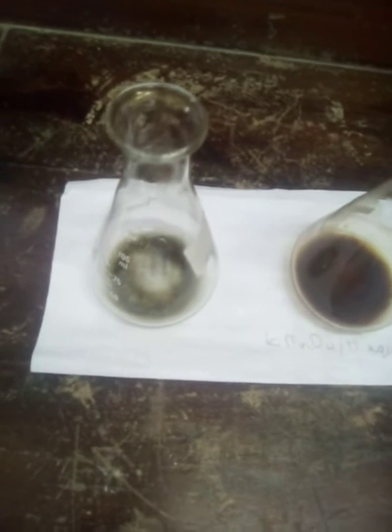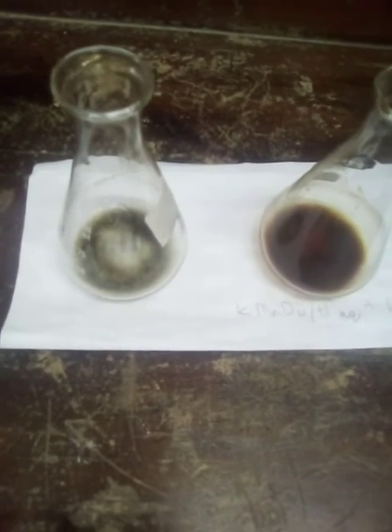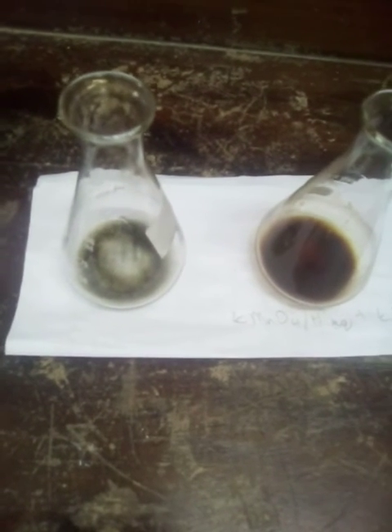So you saw it today, we have the blue-black color change, and that identified that iodine was present in this mixture. So this redox reaction between acidified potassium permanganate and potassium iodide solution was successful, and elemental iodine was formed as a result of that.